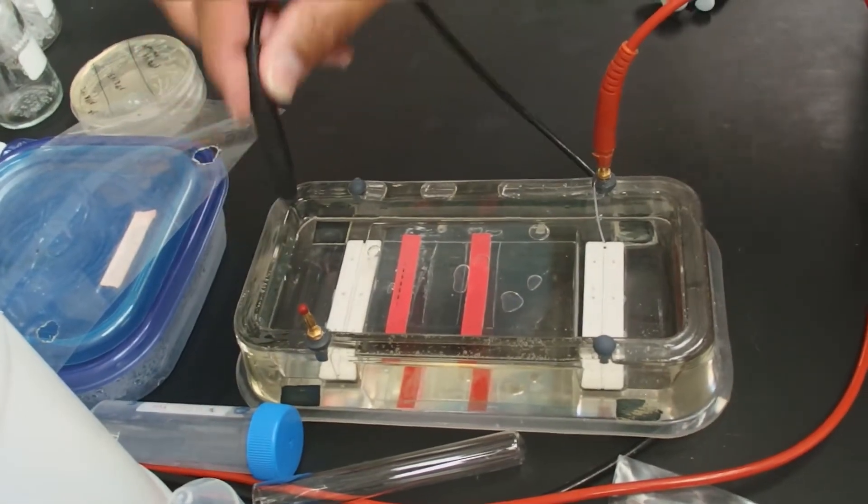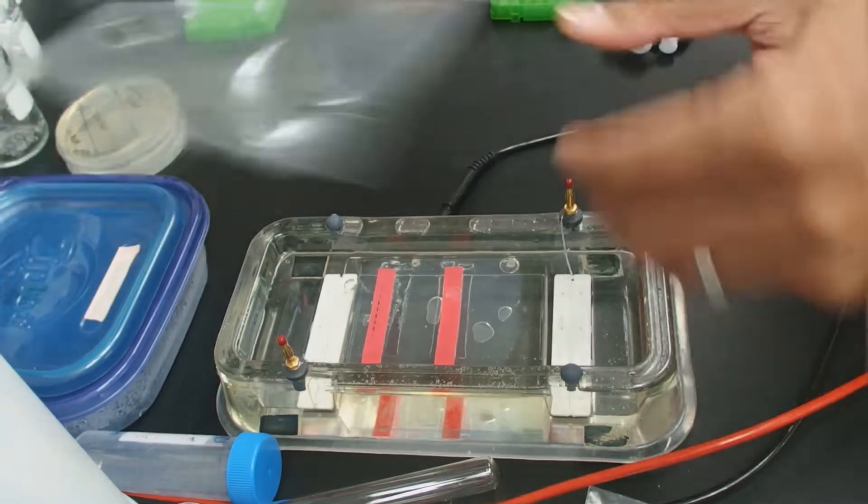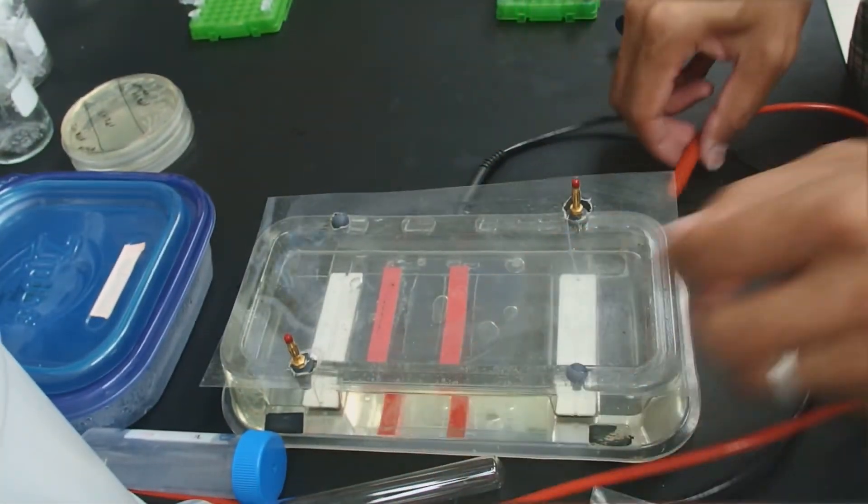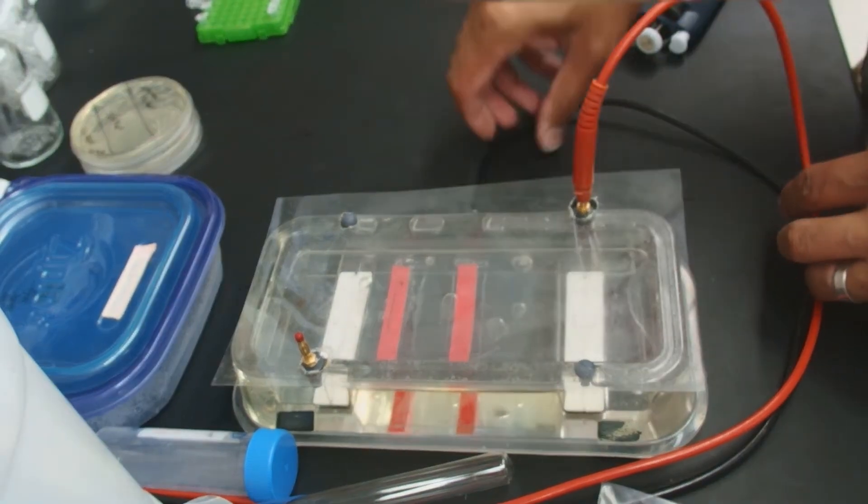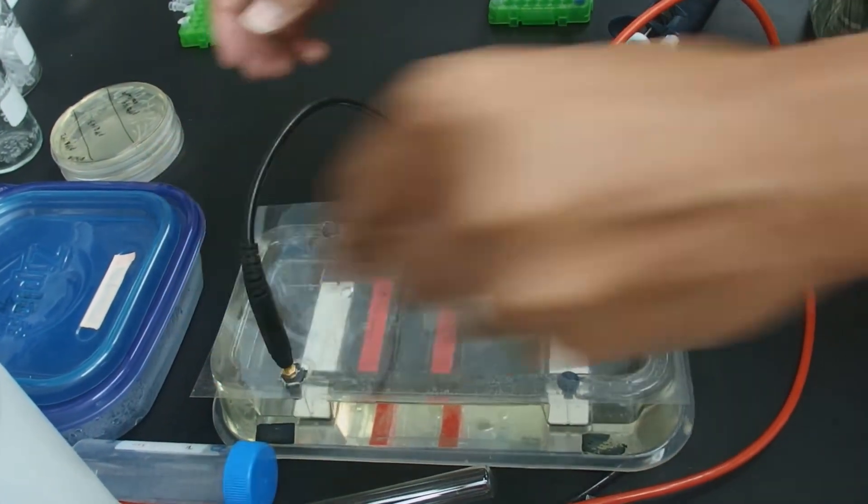Hook up our gel. The DNA always goes toward the positive. It's negatively charged.